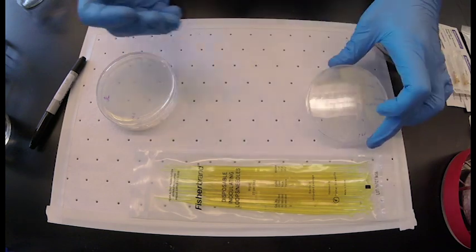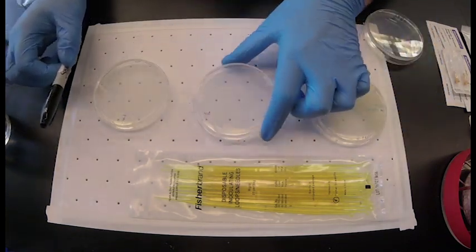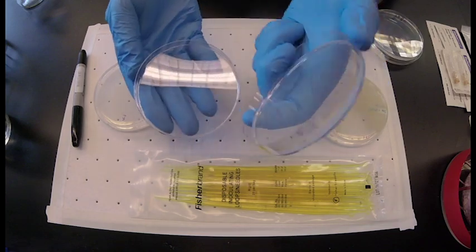This is done by streaking bacteria on the plate with a sterile loop. First I'll show you how to do this with a sharpie.